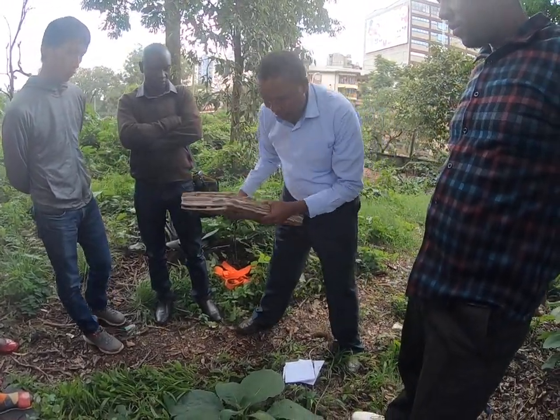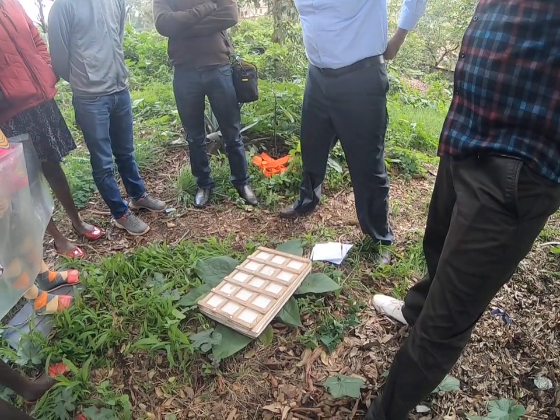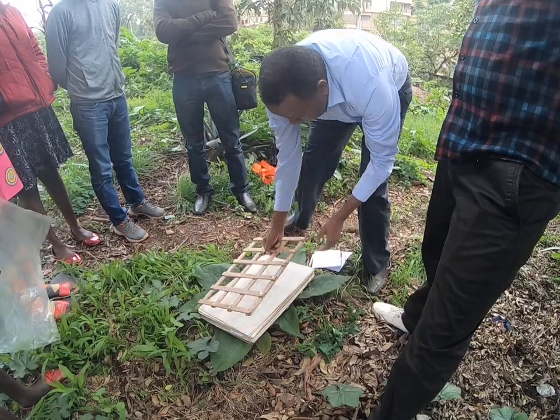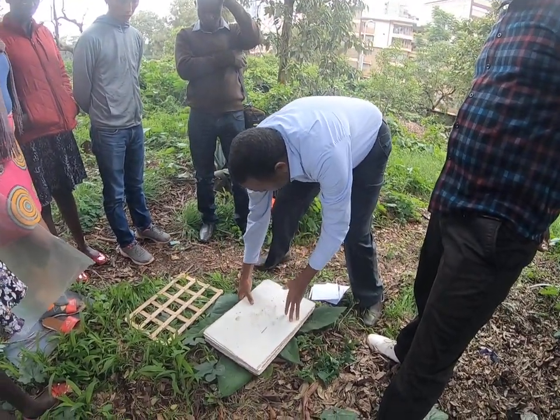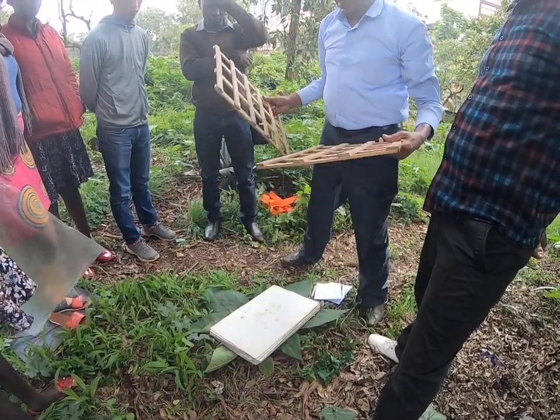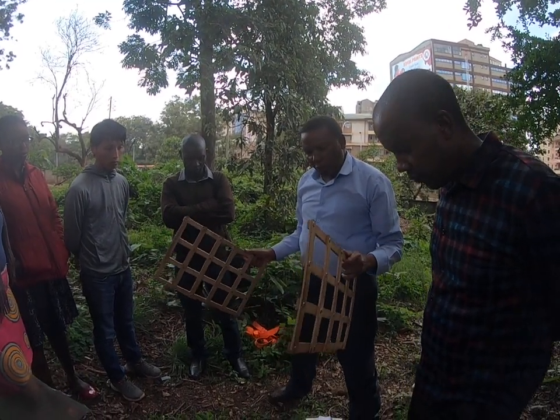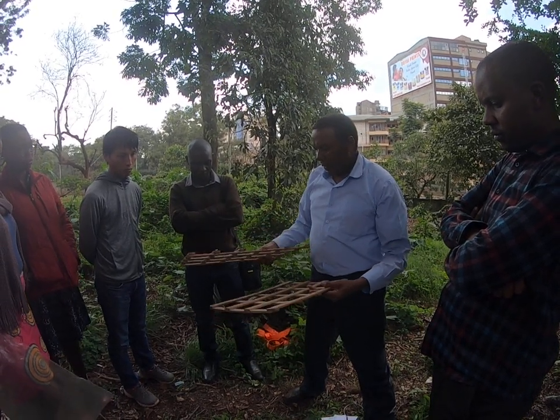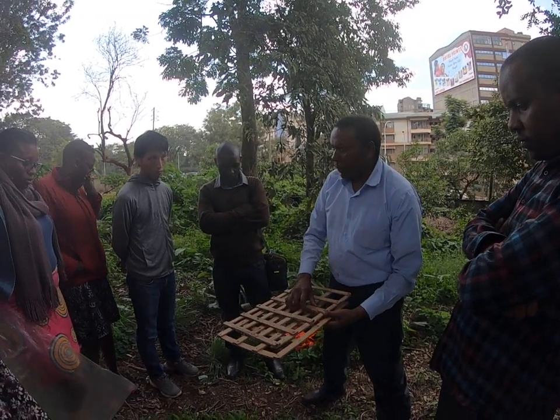So this is a plant press. Let's first of all learn about it. A plant press will normally have this, which is known as the frame. So you have two frames, which of course are like the rib for pressing your plant specimen.